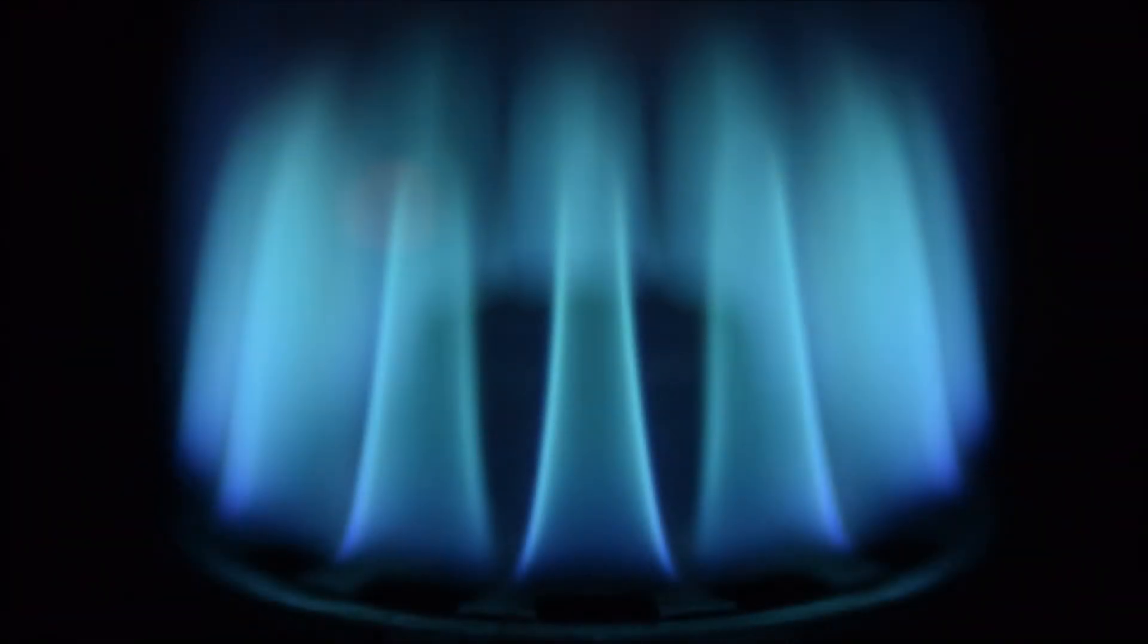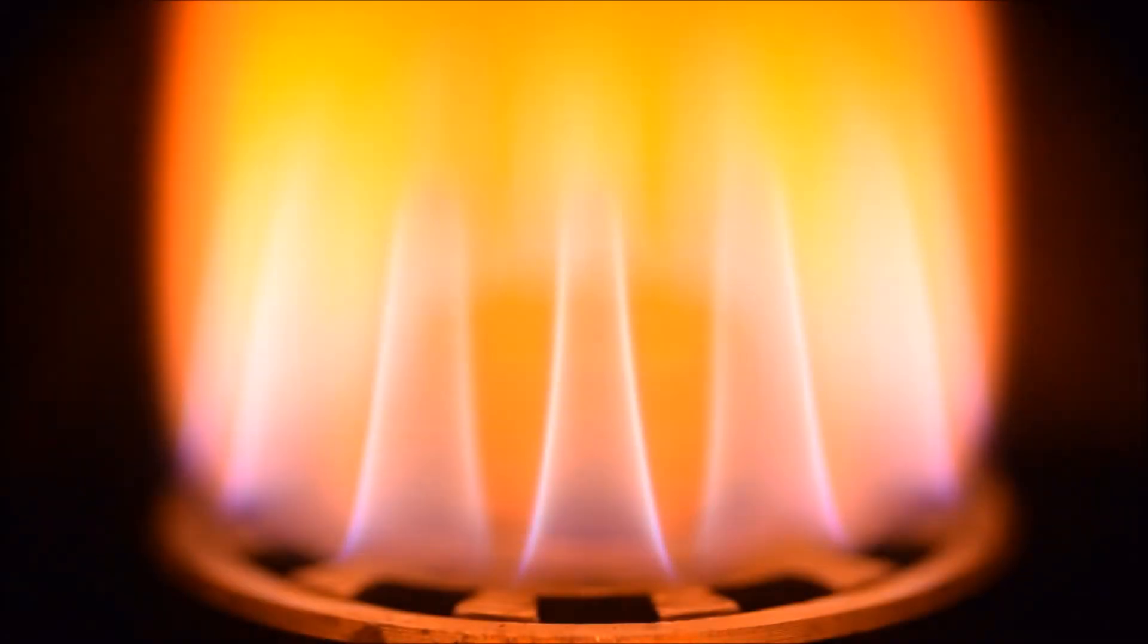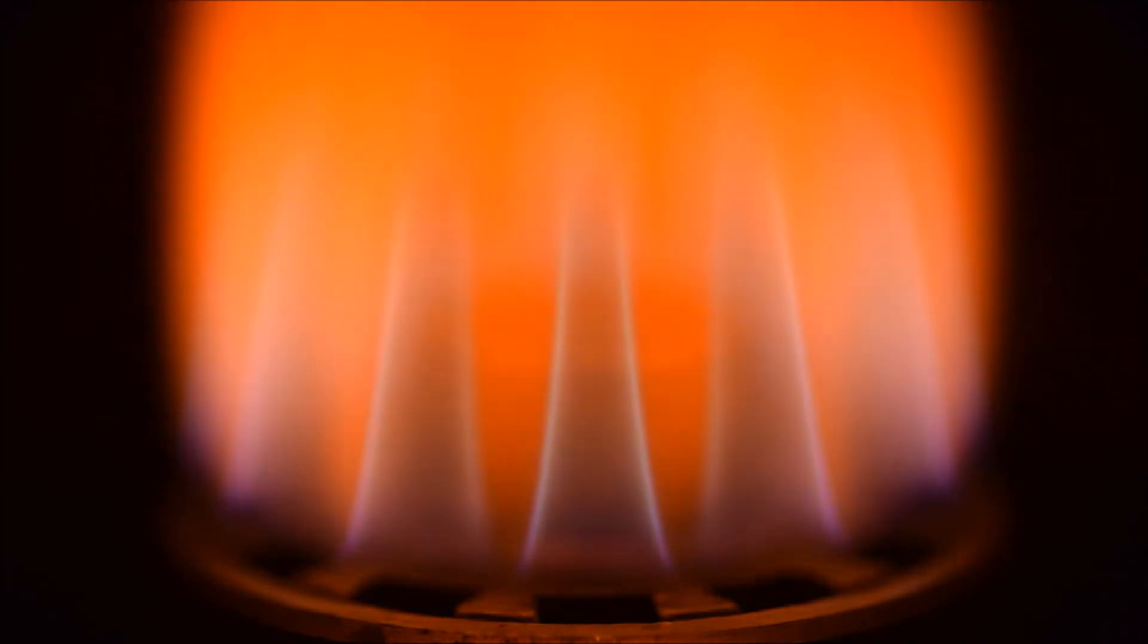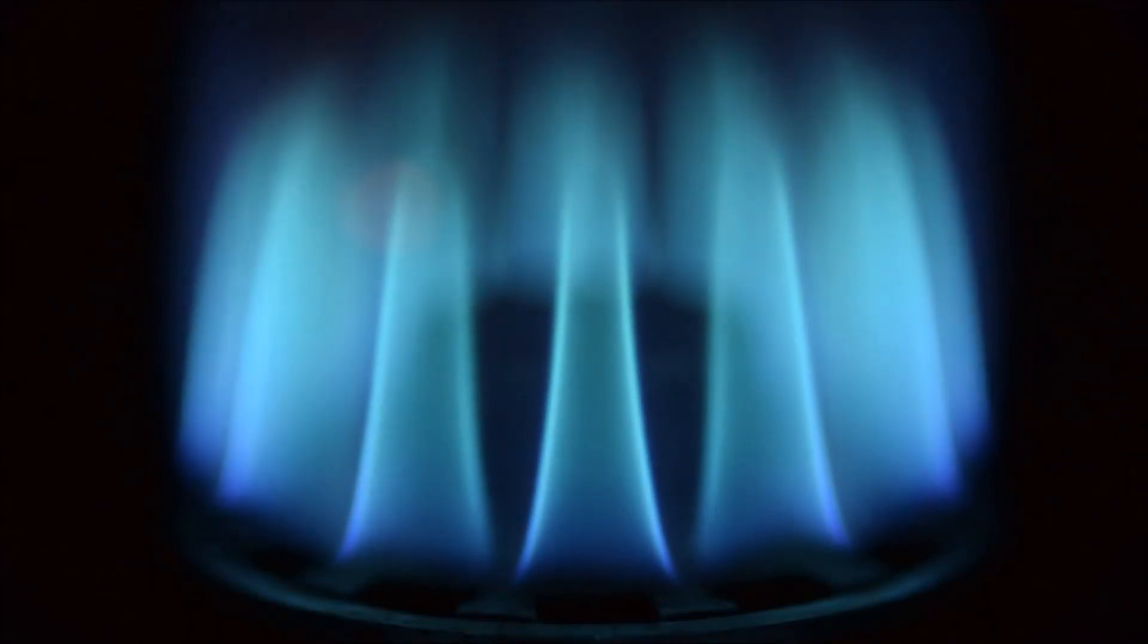Let's have a look inside the machine. Inside the machine, you can see the gas flame burning away, and it makes sense now why the reading is not perfectly consistent and why you have some drift. When we introduce our sample, we see a change in the colour of the flame. That colour is due to the emission, due to the sodium atoms being excited and then emitting photons as they return to their ground state. These photons have a particular wavelength for a particular metal, and so we can measure that light and ignore all the other wavelengths of light that are emitted.